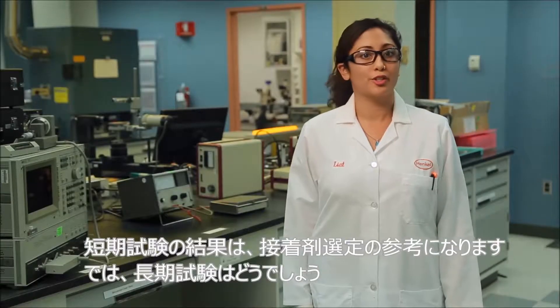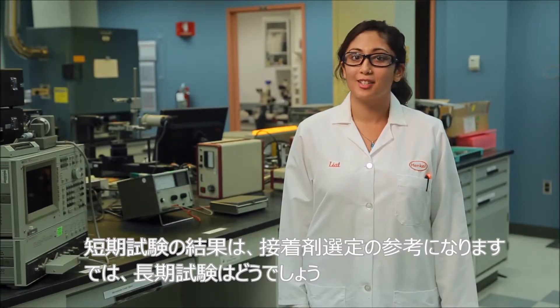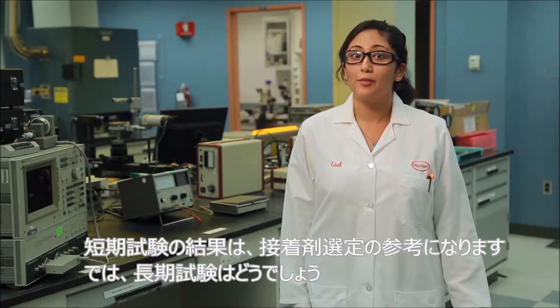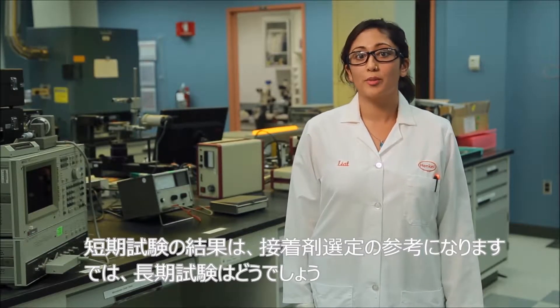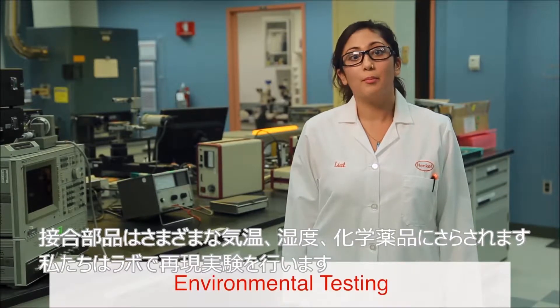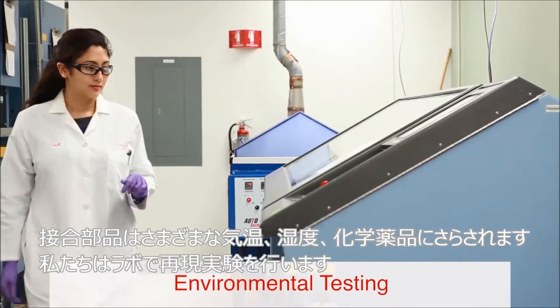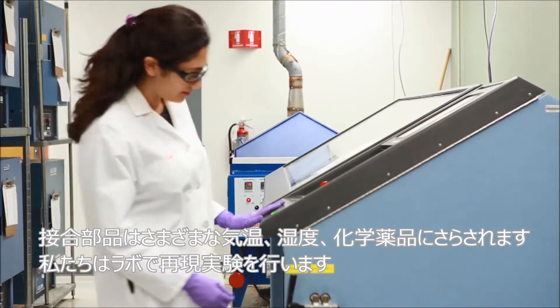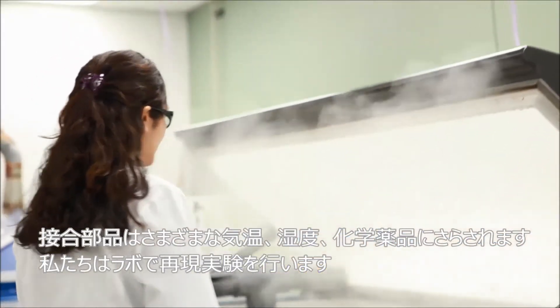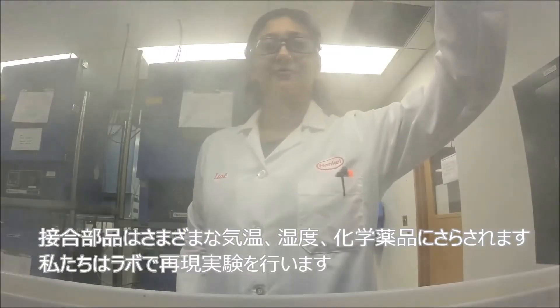Results from short-term tests can help to guide us in the selection of an adhesive, but what about the long-term performance of the bonded assembly? In the real world, bonded parts are exposed to various temperatures, moisture levels, and harsh chemicals — and we do the same to our assembled bonds in the laboratory.